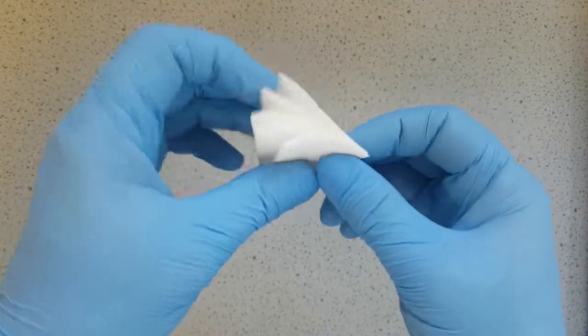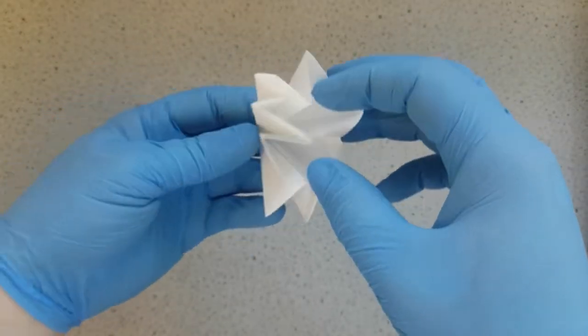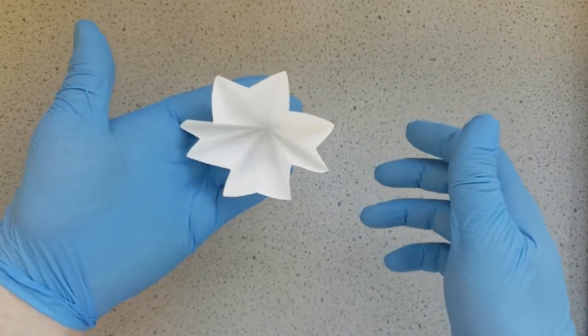Like so. And there we are, the fluted filter paper.